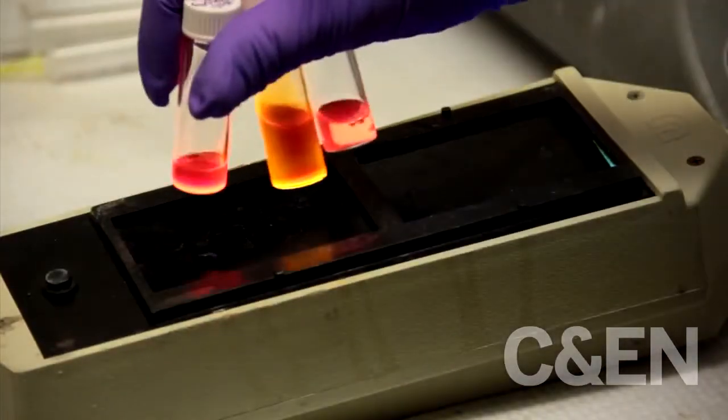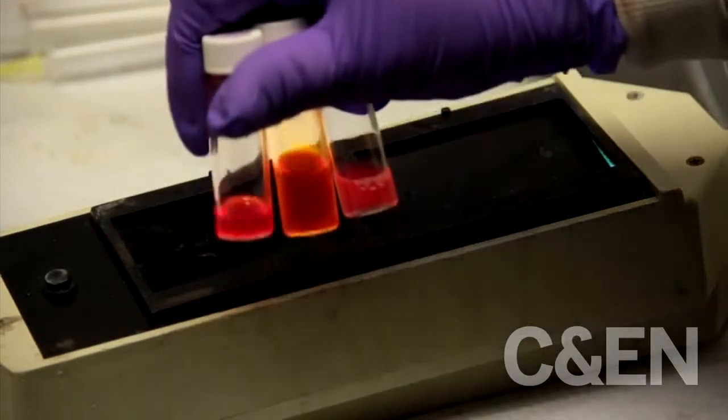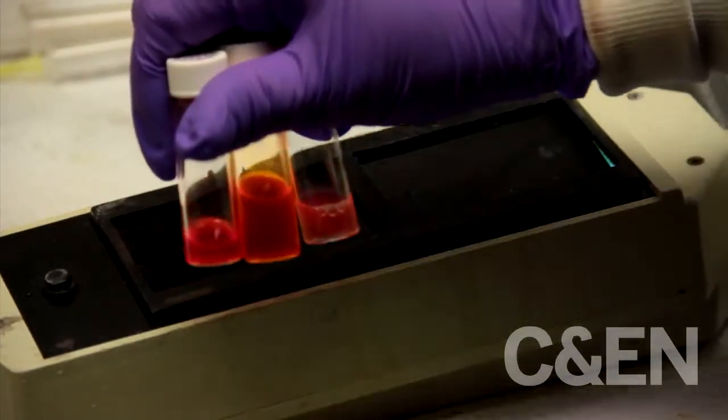And you end up with something like this. The reason they fluoresce is because they're excited with the UV light. So when we take away that UV light, they no longer glow.